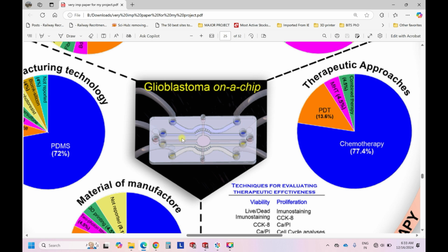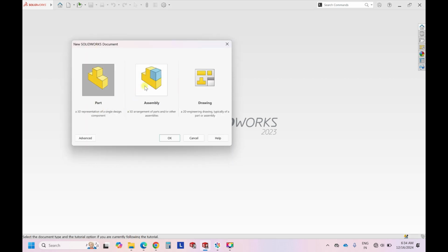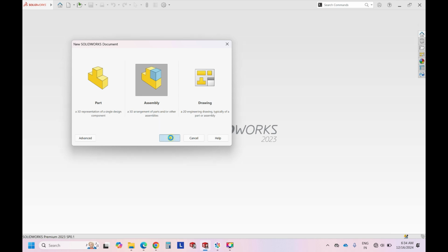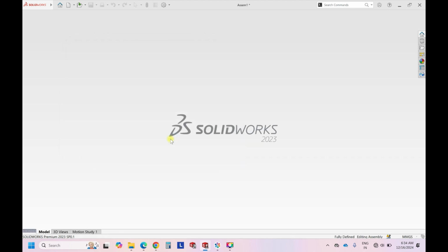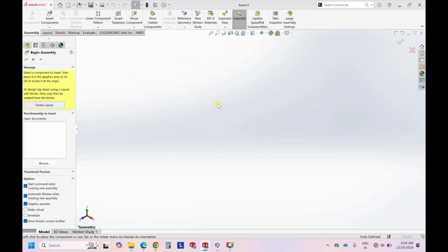I'll divide this into 5 different units so that it is easy to understand. First we will start with designing this inner circle, and then I'll explain how we can move forward to do all these complex things. Let's go ahead. Now I'll open my SolidWorks design. As I told in my previous videos also, it is always recommended to go to assembly because the user wants it to be 3D printed instead of soft lithography. The paper explains soft lithography, but the user is more interested in 3D printing this kind of devices.